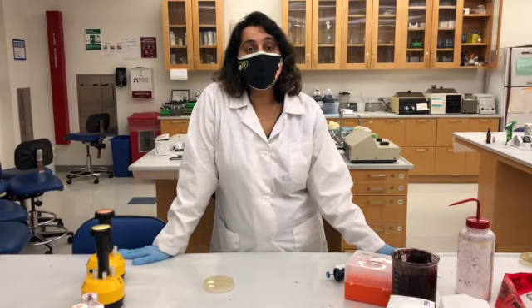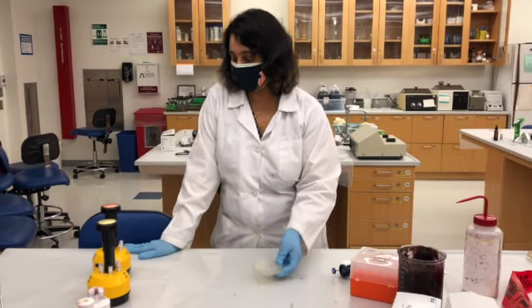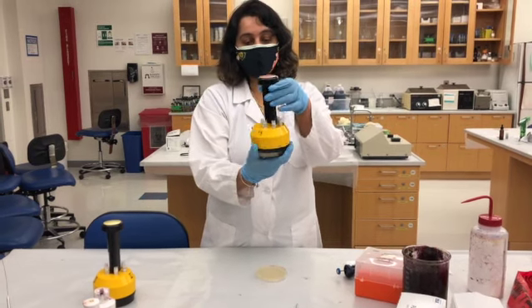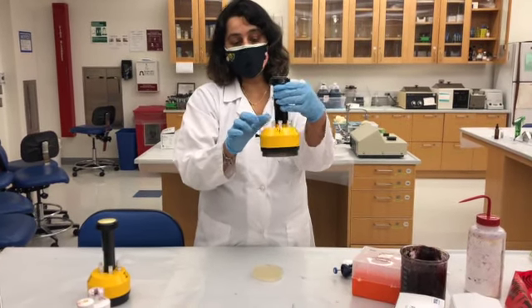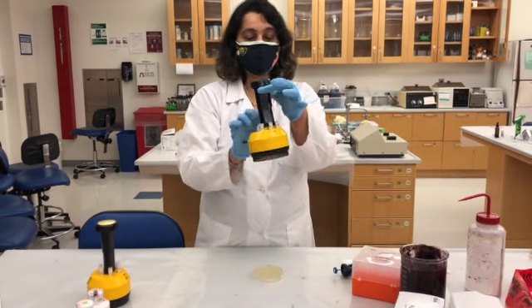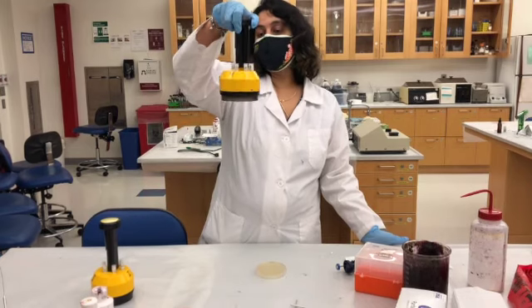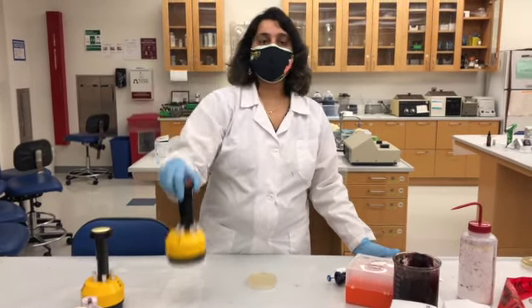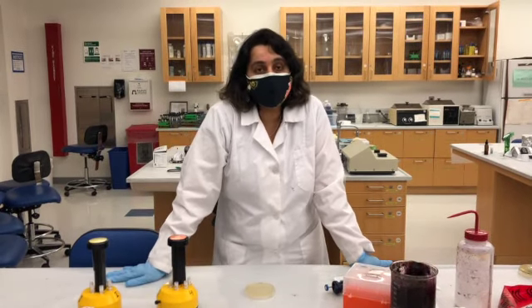So for that, commonly used method is the Kirby-Bauer disk diffusion method. This little tool that you are seeing here is the antibiotic dispenser. Okay? So you have 1, 2, 3, 4, 5, 6. There are 6 antibiotics, which are different antibiotics. Some are cell wall inhibitors, some are cell membrane inhibitors, some are bacteria protein synthesis inhibitors.